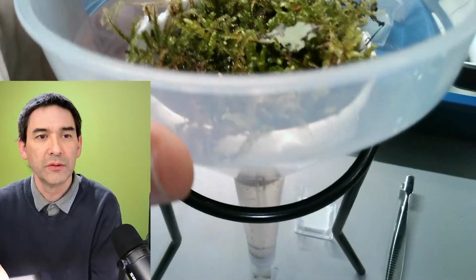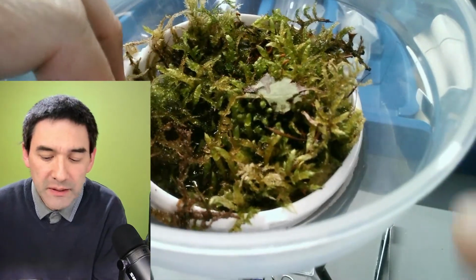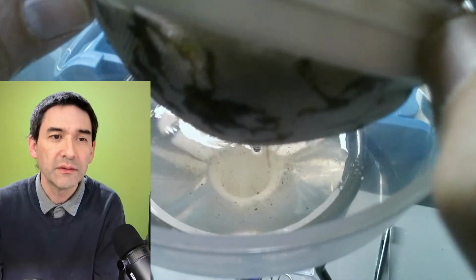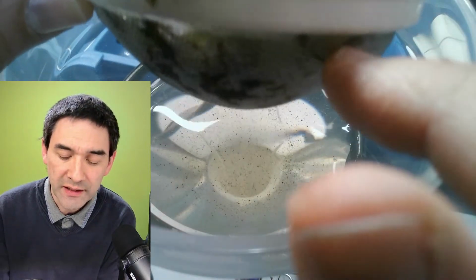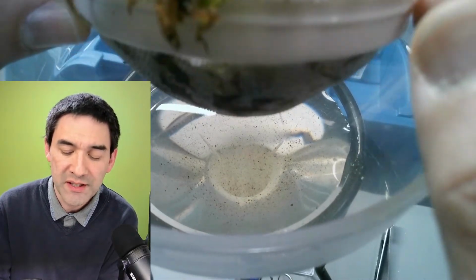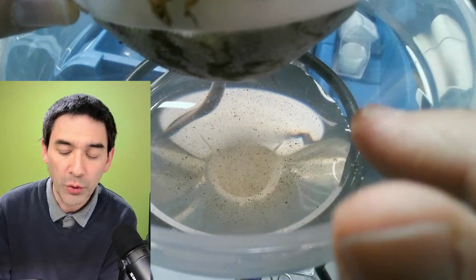So this here is a plastic funnel. You can take it out. It looks like this, right? And in this plastic funnel, what I have here is a sieve. So it looks like this here, right? It's actually used for, I don't know, if you want to separate tea leaves or things like that. There was also a handle on here which I cut off, so that I can put the sieve directly in here. And in it I put some moss, and filled up everything with water.